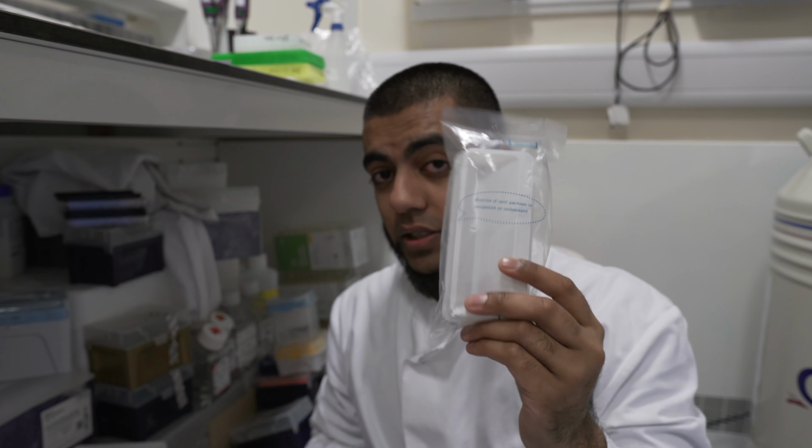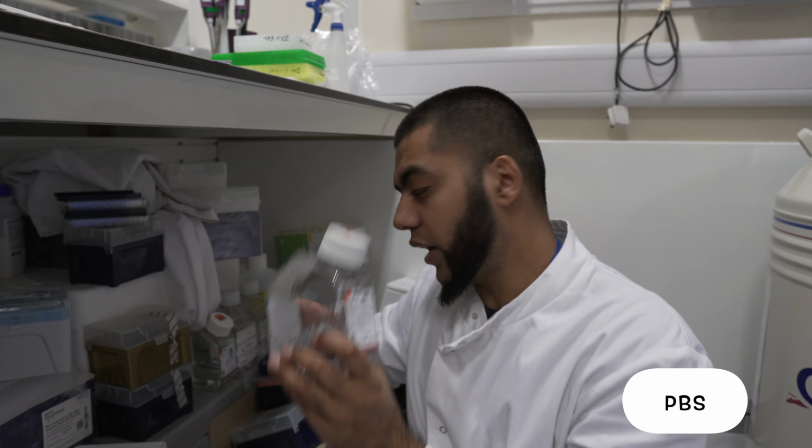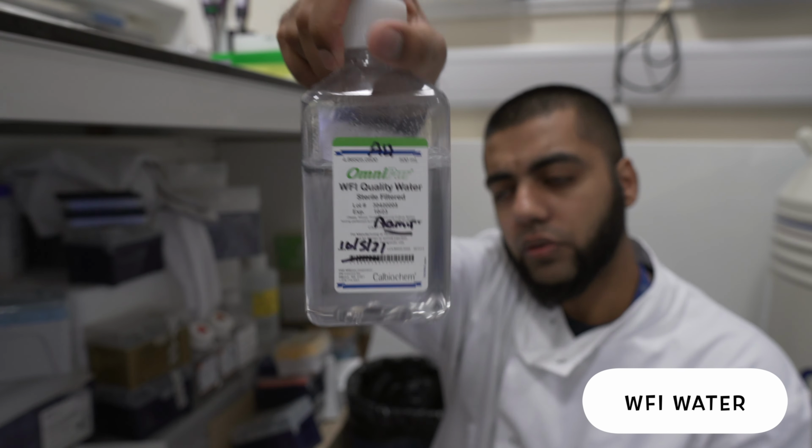We've got those, which are the PCR plates, for those who know about PCR and do PCR. They've got stuff like this reservoir. I'll come back to this because it's actually quite handy. Various, you know, PBS, stuff like that. Pure water that I've got over here. Yeah, water. We've got water over here.